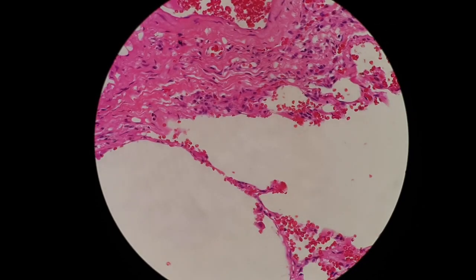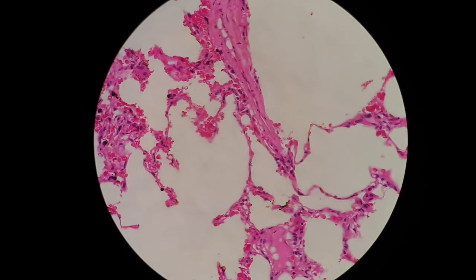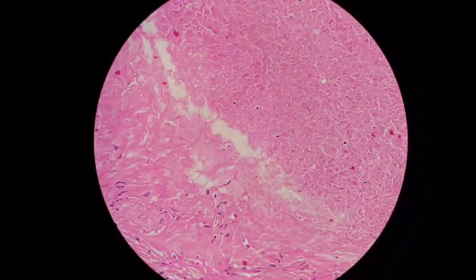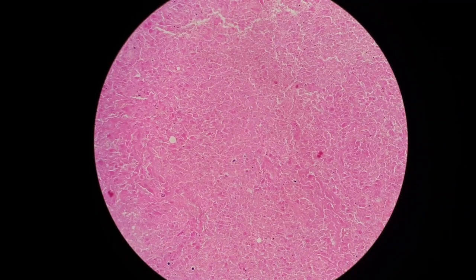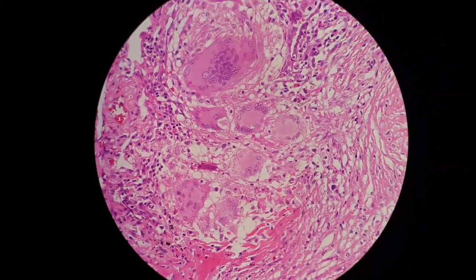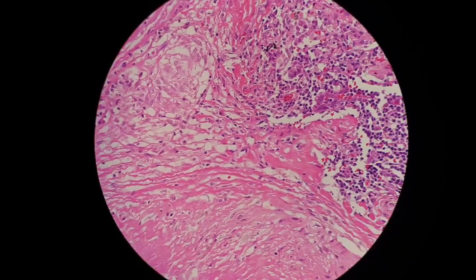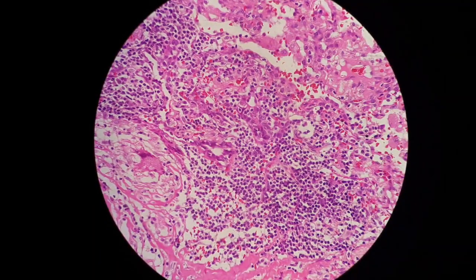Under high power, you can see clearly that the alveolar spaces are lined by simple squamous epithelium. The lesion consists of necrotic material at its center — just pinkish acellular material. Sometimes you can see ghost cells. Adjacent to it is a collection of histiocytes and also multinucleated macrophages, and surrounding it is a collection of reactive lymphocytes.